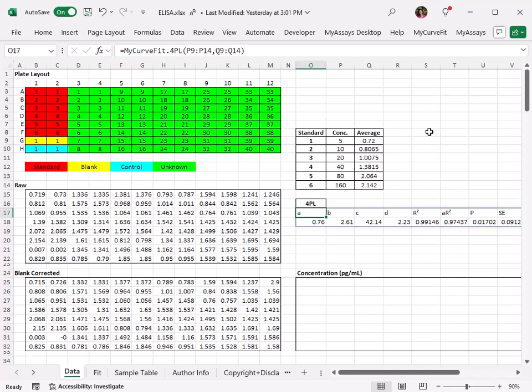In this case, I've already calculated my 4PL parameters using the calibrator X and Y values from this table. The X values are the concentration values from my assay kit insert, and the Y values are the average blank corrected values for each standard sample. Now I want to use the CalcX function to calculate the concentration value, or X value, corresponding to the blank corrected value, or Y value, for all the samples on my plate.